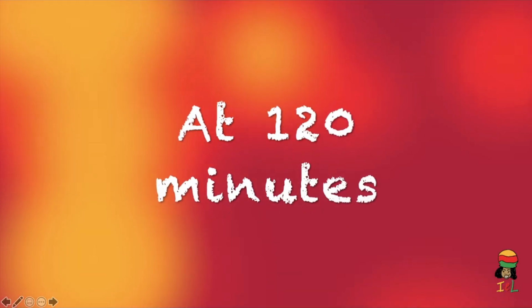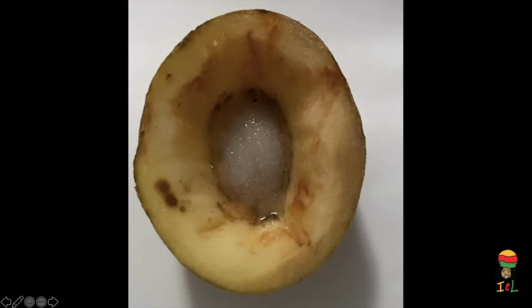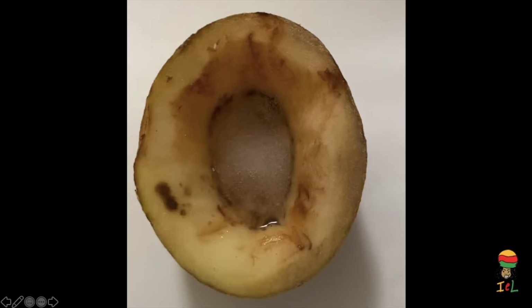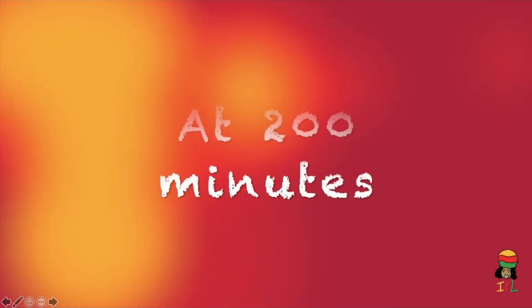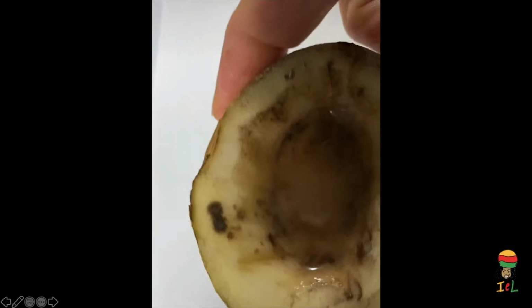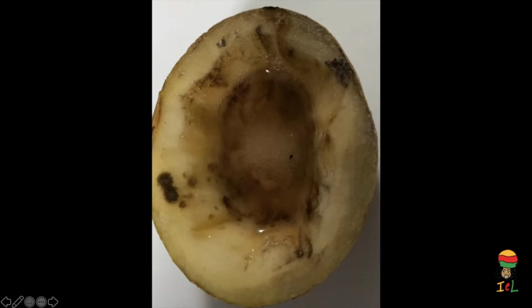At 120 minutes, water accumulates in the potato cavity covering the salt sample, and the amount of salt in the cavity has been reduced. At 160 minutes, the water volume in the cavity has increased significantly. There is a further reduction in the quantity of salt crystals. At 200 minutes, a colorless solution that has a salty taste fills the potato cavity, and only a few salt crystals are visible at the bottom of the cavity.